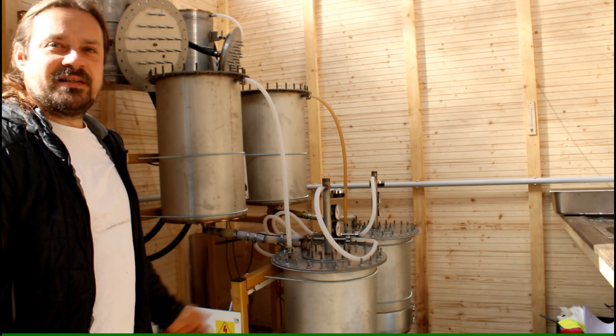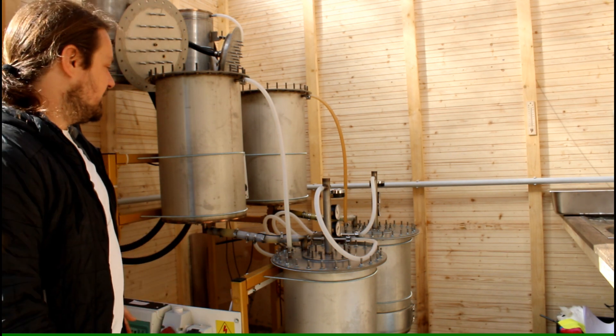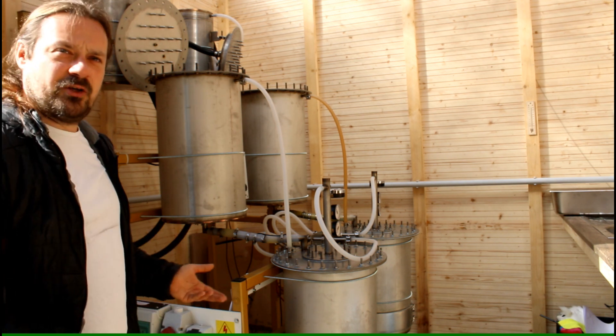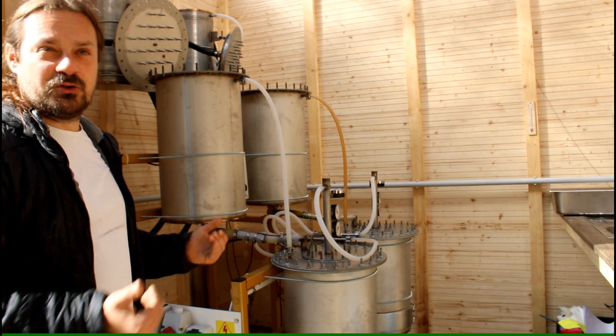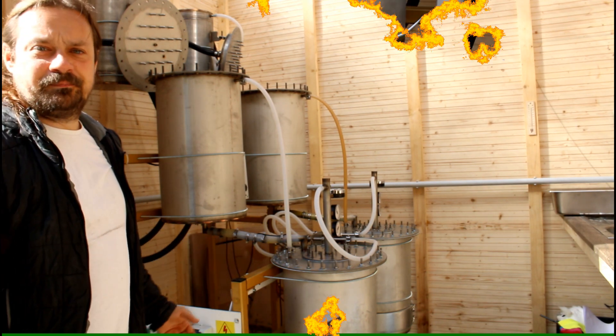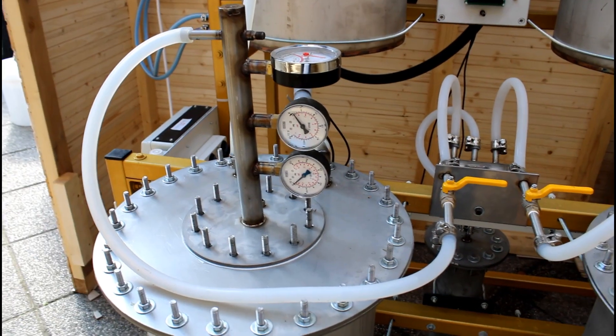And everything runs under vacuum. That means before I start the system I completely evacuate it down to 200 millibar and then I start the heating. So let's have a closer look on the system.